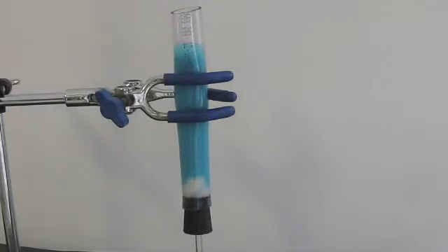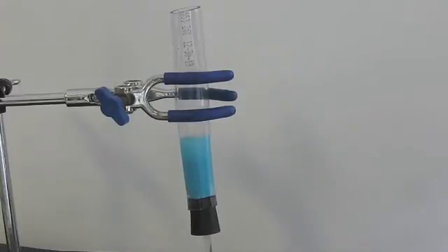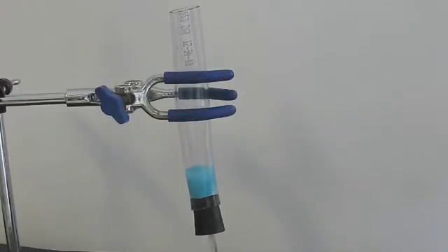Now, when you try this, you should experiment with different widths of tubing. The tubing that I used allowed for a quick flow of liquid, but most of the solids stuck to the wet cotton and thus didn't dry properly. Had I used a narrower tube, it would have taken a bit longer, but I would have been left with a powder instead of a paste.